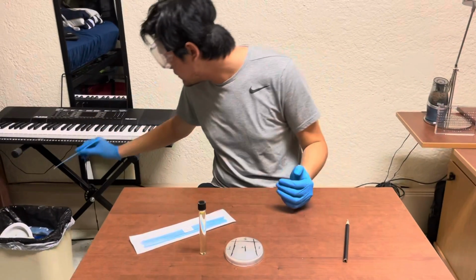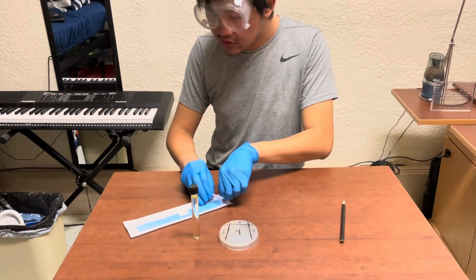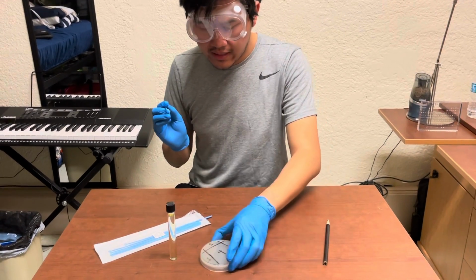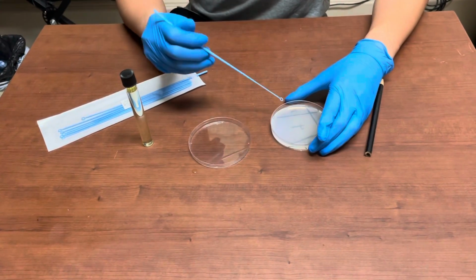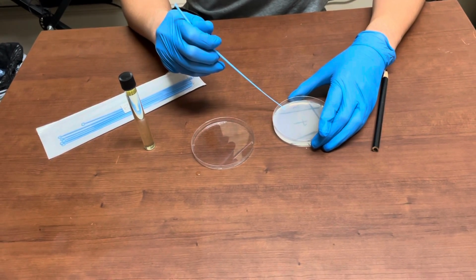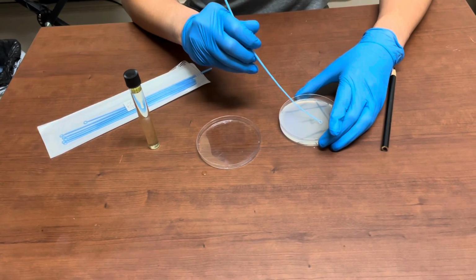I'm going to dispose of the plastic inoculation loop, and now finally I'm going to take another plastic inoculation loop, and I'm going to rotate counterclockwise 90 degrees, and I'm going to open the agar plate, and from the corner of quadrant 3, I'm going to start here and diagonally spread this out across quadrant 4 like so.